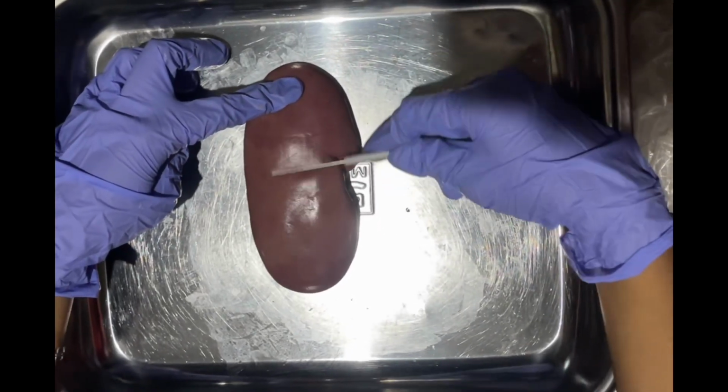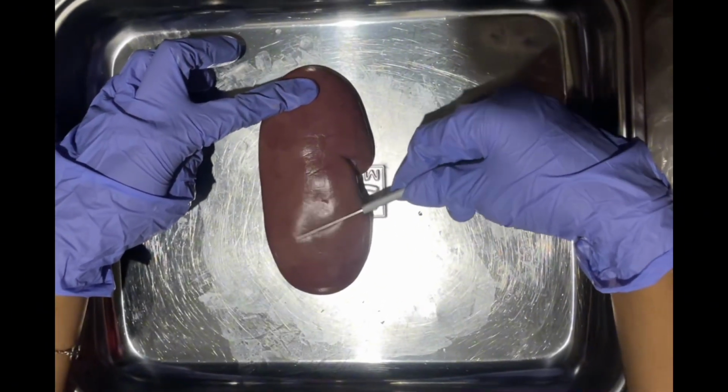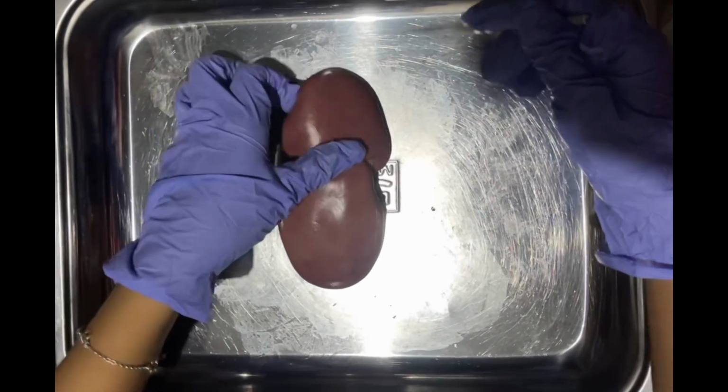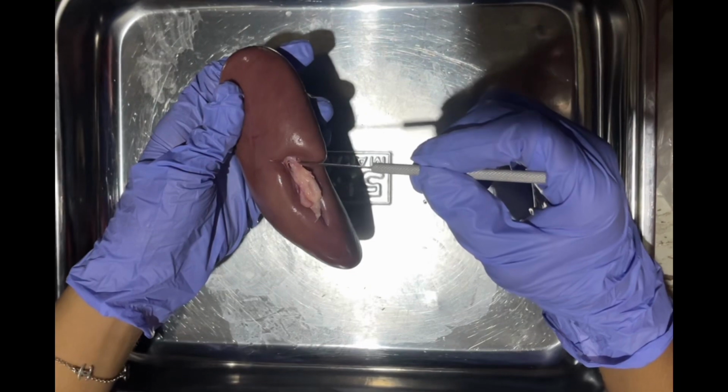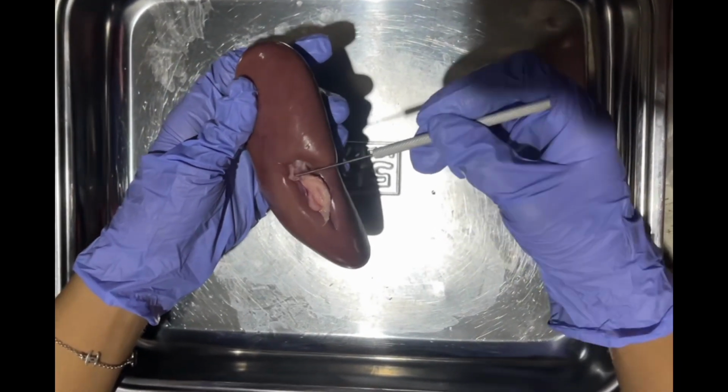In this video, we're going to dissect a pig's kidney. So let's start. This is the renal artery. It carries large amounts of blood from the aorta to the kidney. And this is the renal vein.